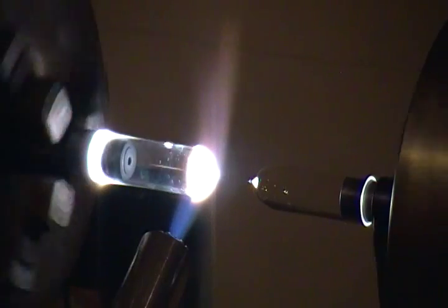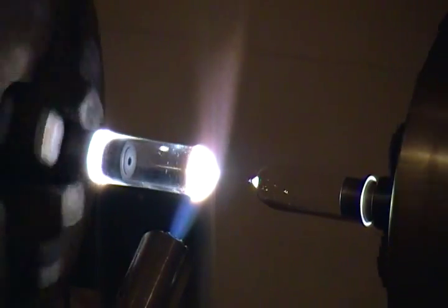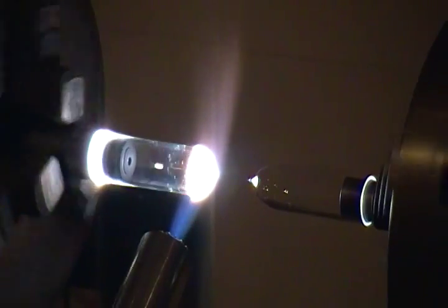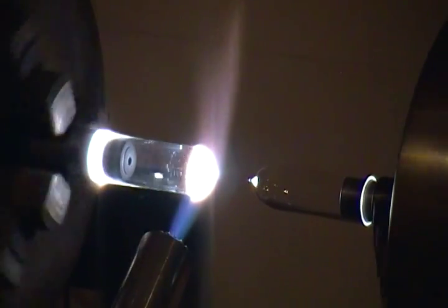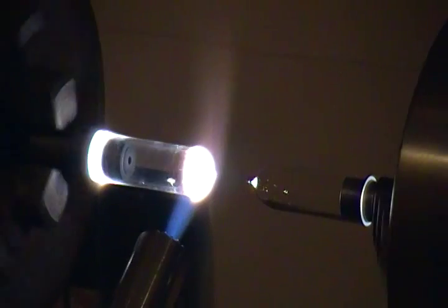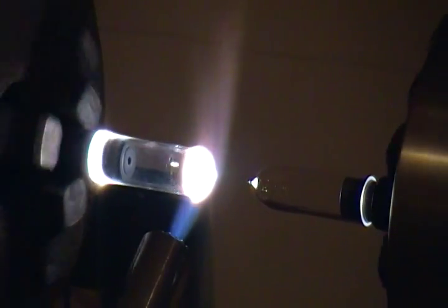You want to avoid blooms, so you have to use the right amount of heat. You don't want to use too hot of a flame and over-temp your quartz material and start vaporizing it, and then you get this vaporized silica that deposits outside of the heat of the flame down the colder spots of the glass, and it starts to become a problem. So using the appropriate amount of heat is really important so that you can get what you need out of it without just getting a real mangled up piece. And then you have to etch it out, either burn it off or etch it out in hydrofluoric acid, which is just bad stuff. So anyway, we're gonna clean this up, and that'll be that.